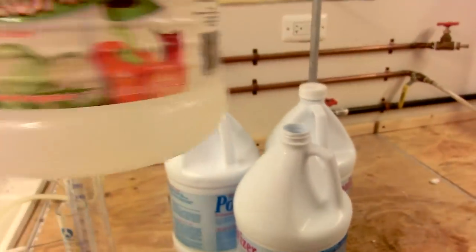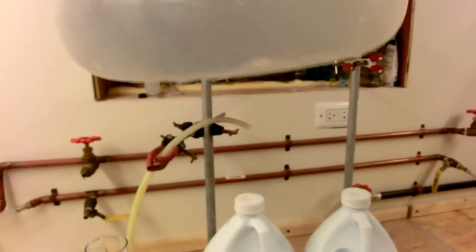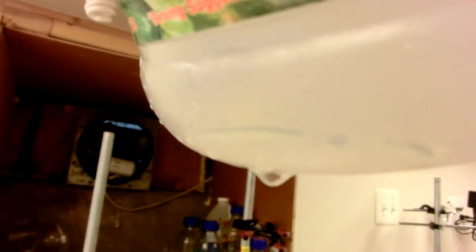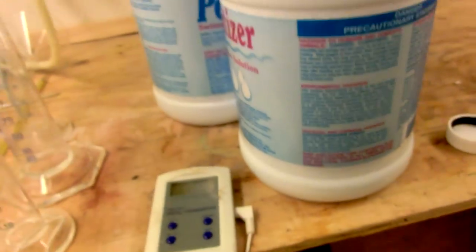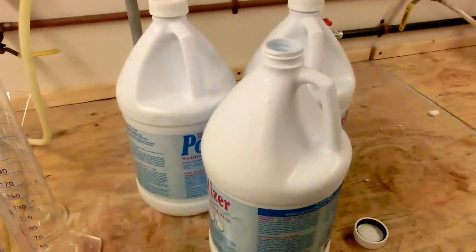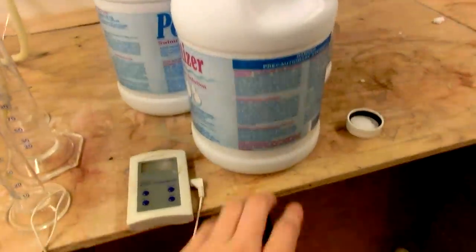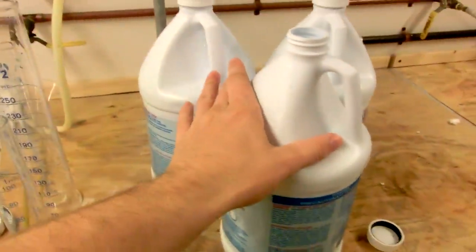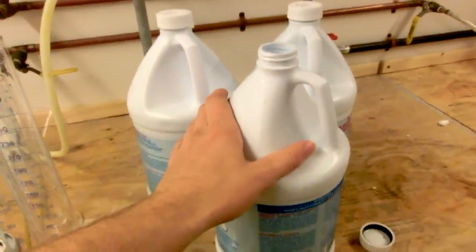I've prepared a small example here: a jug of water with a little bit of chloroform in it. If I tilt the jug, you might be able to see that little layer of chloroform in the bottom — see how it moves around? That's maybe 10 milliliters in there inside a one-gallon jug, but the premise is the same. There's going to be a lot of chloroform in the bottom of all these jugs. We're going to wait about an hour for it to settle, then decant most of the liquid off the top, leaving maybe 300 milliliters of liquid in the bottom with the chloroform, and pour it all into a separatory funnel for continued separation.